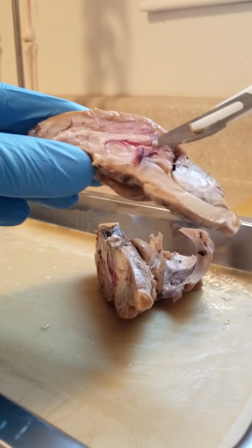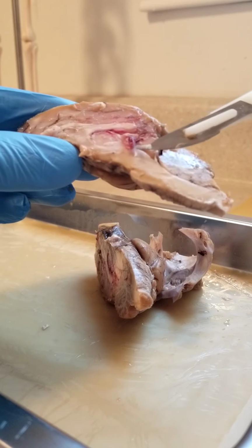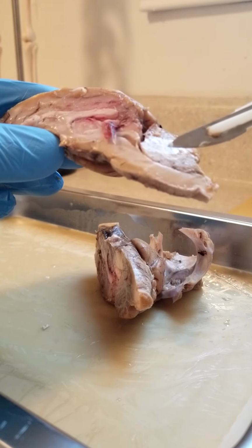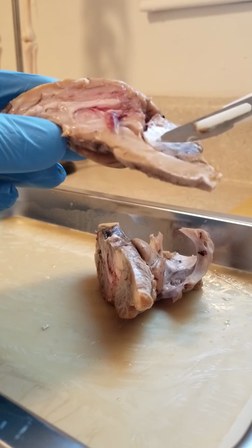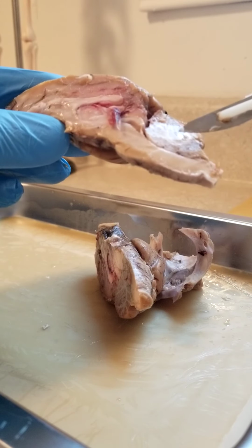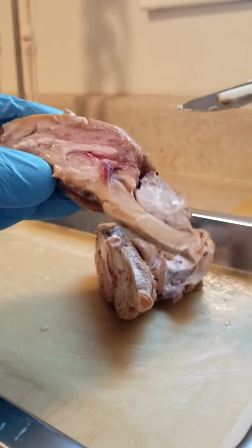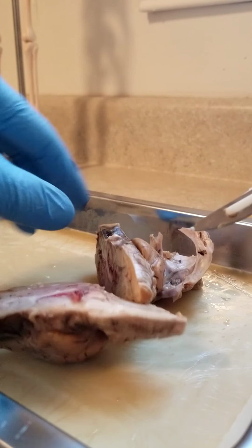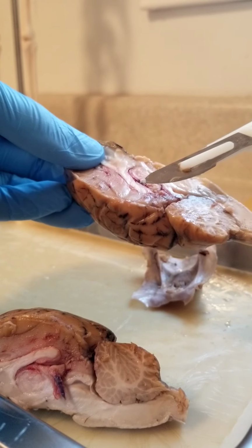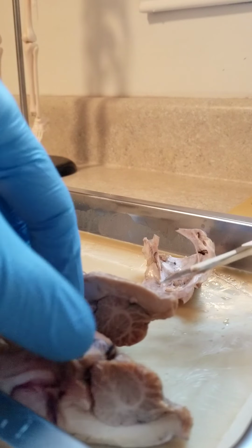And the choroid plexus right there, going to the third ventricle, that area. The cerebral aqueduct, that's kind of the end there, and that'll actually connect the third and the fourth ventricle. And then arbor vitae, the top end right there, it's the white matter. Then when we discussed the white matter and gray matter, it's kind of exactly that. White matter, definitely that lighter in color. And gray matter is that darker color there. That's going to conclude everything there.